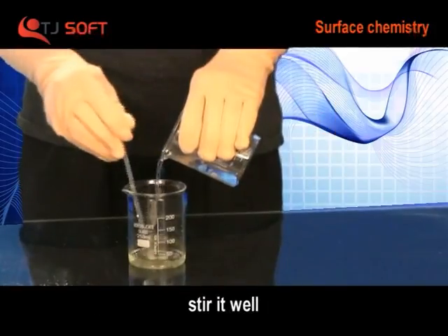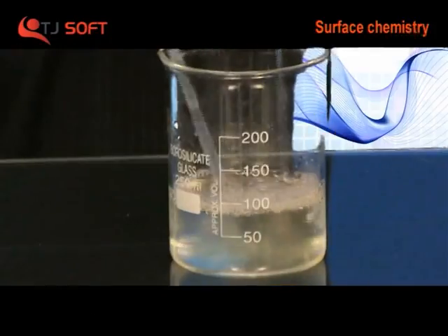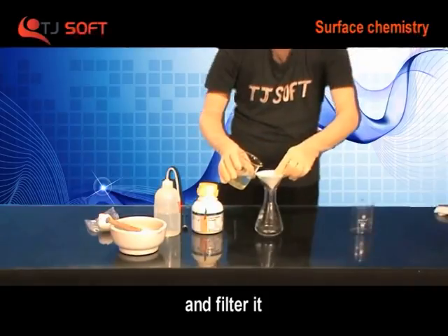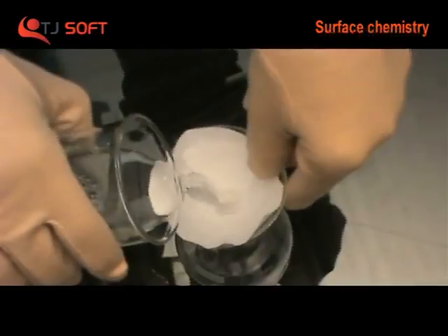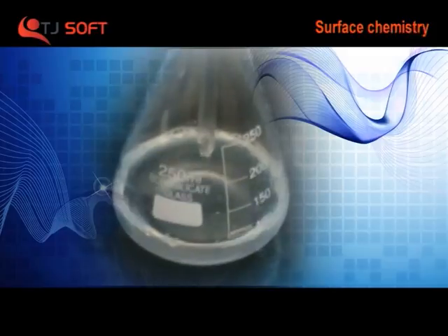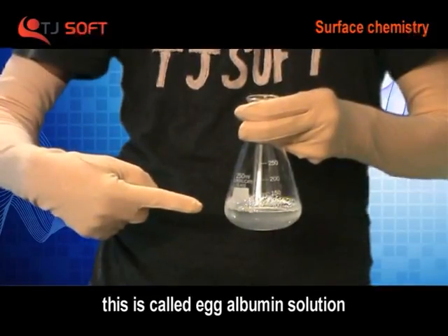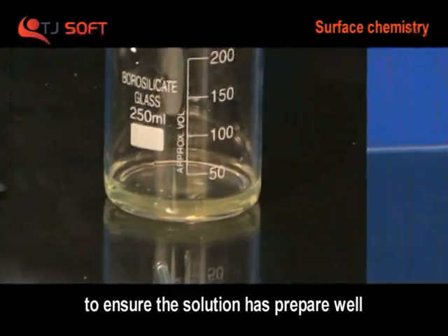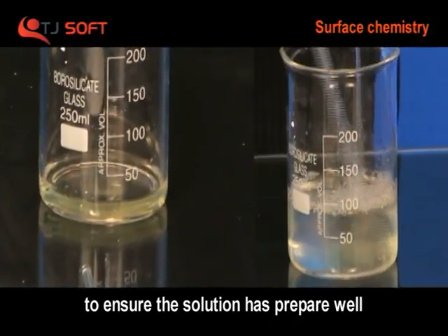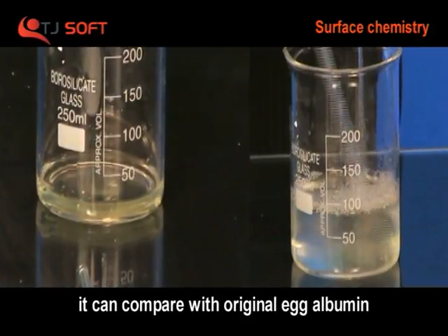Stir it well and filter it. The resulting solution is the egg albumin solution. To ensure the solution is prepared well, it can be compared with the original egg albumin.